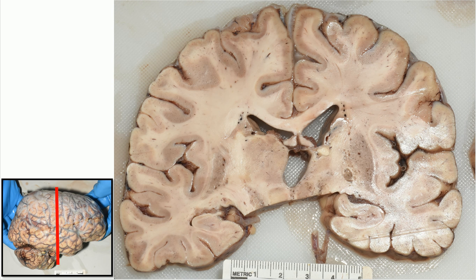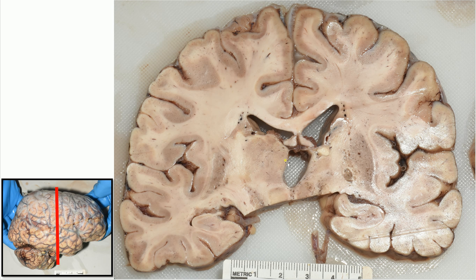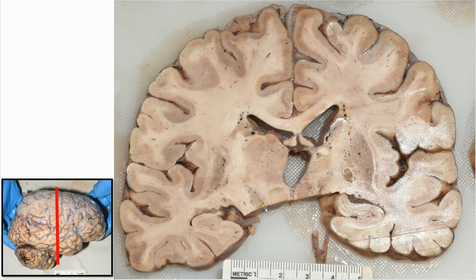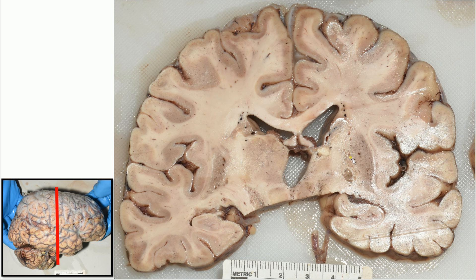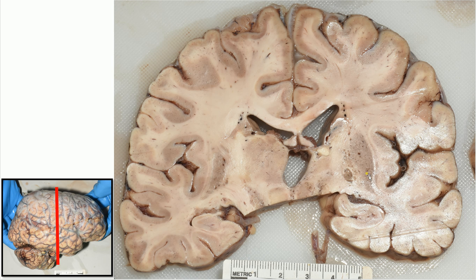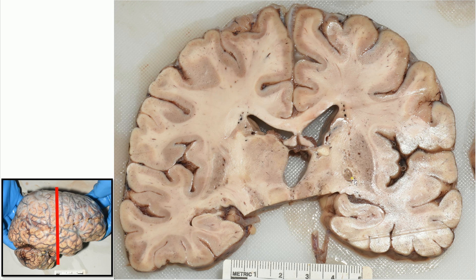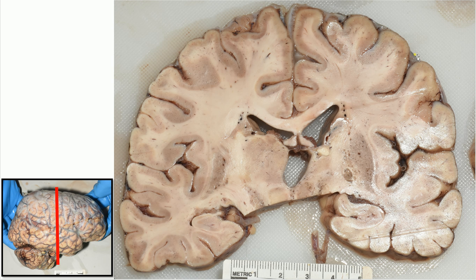Going to our next section, we've moved a little bit posterior. Here's the corpus callosum, the thalamus, the posterior aspect of the putamen, the hippocampus, the red nucleus of the midbrain, and the substantia nigra. Again, we can see that the basal ganglia are involved by these little cyst-like structures, the largest one being visible here. These little cyst-like structures have what is known as a soap bubble appearance, and they are associated with a very severe-looking meningitis.